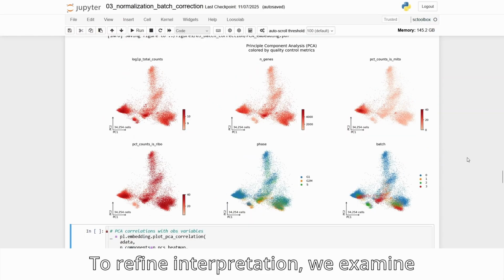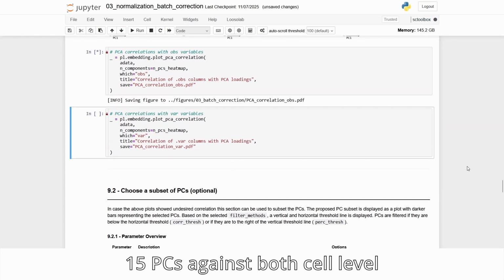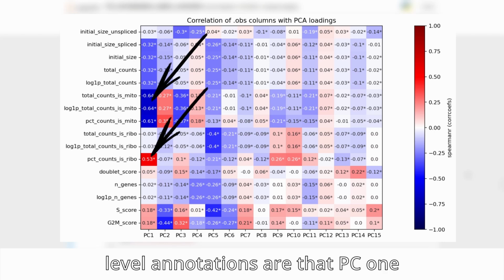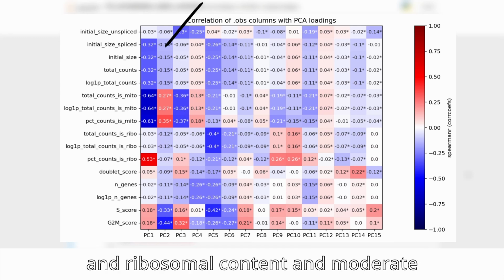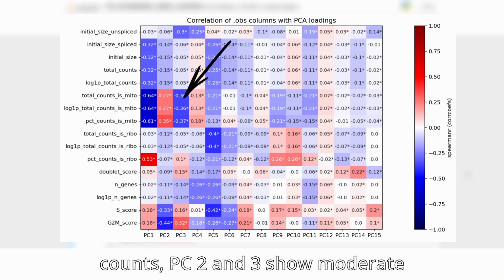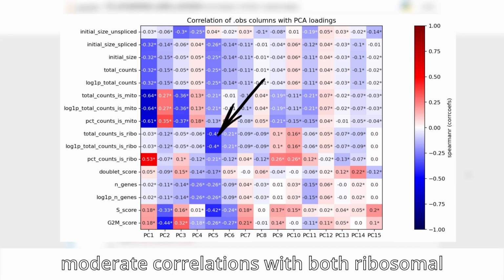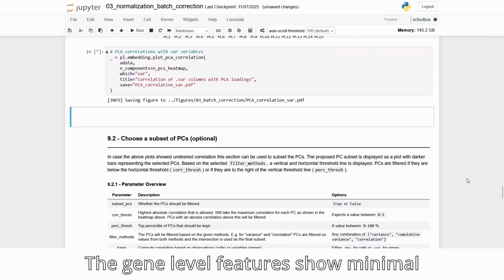To refine interpretation, we examine correlation heat maps comparing the top 15 PCs against both cell-level annotations and gene-level features. The key observations for the cell-level annotations are that PC1 shows strong correlation to mitochondrial and ribosomal content and moderate correlation with splicing and total counts. PC2 and 3 show moderate correlations with mitochondrial content and cell cycle, and PC5 demonstrates moderate correlations with both ribosomal gene counts and the S-phase score. The gene-level features show minimal correlation overall.